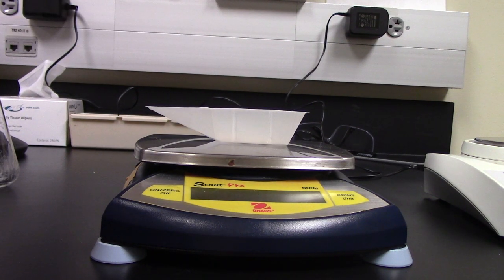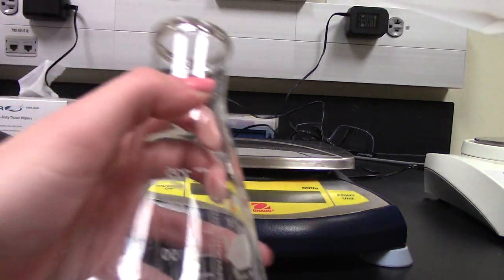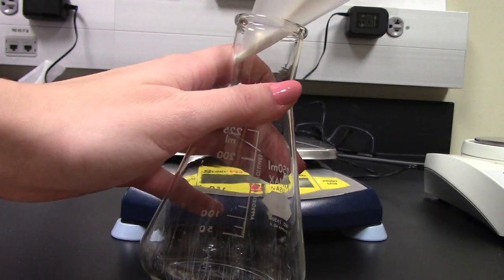I have my 0.6 grams measured out and I am just going to add that into my Erlenmeyer flask.